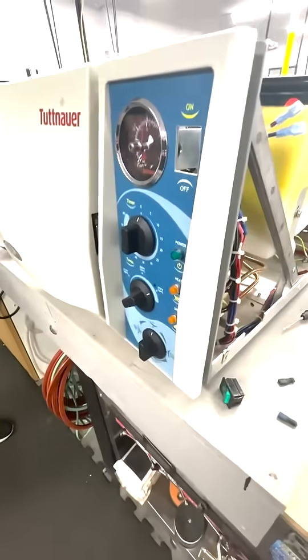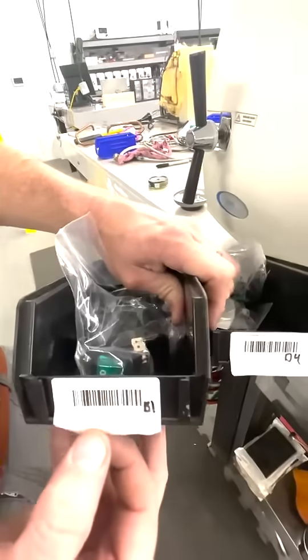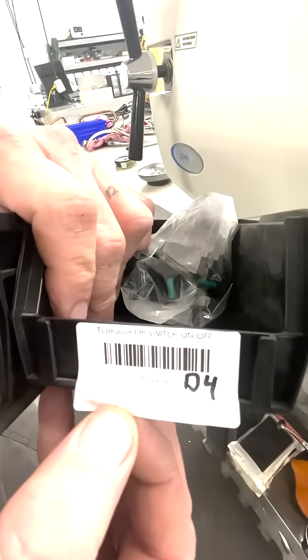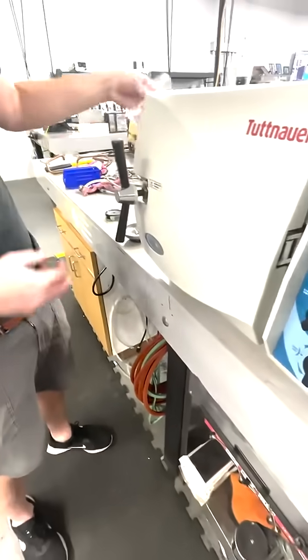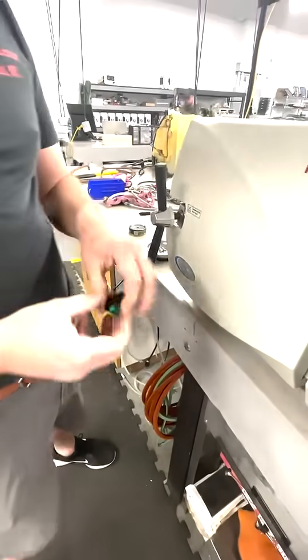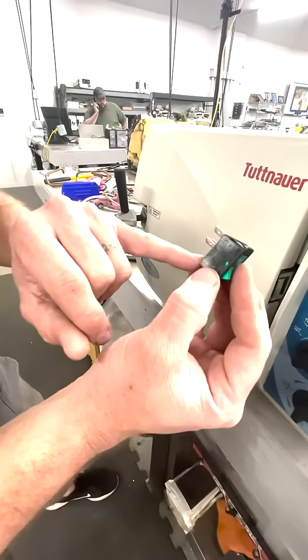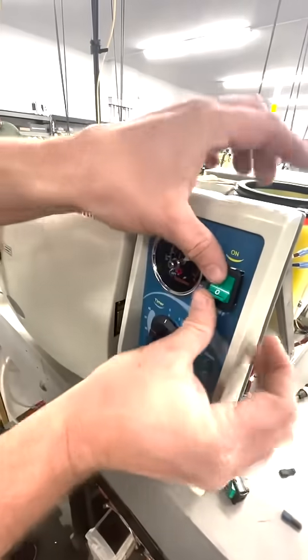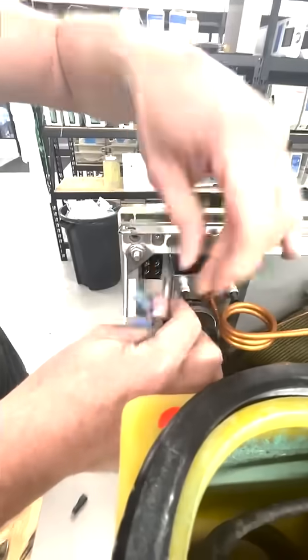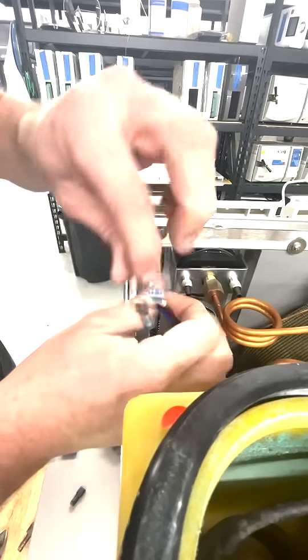Our new power switch — we can either use OEM, which has the part number shown here, or aftermarket. I'm going to be placing an OEM switch into this one. If you notice your wires or connectors are offset, you want the open space on the bottom. The new switch will just press into place — blue double wire on the bottom, blue single on the top.